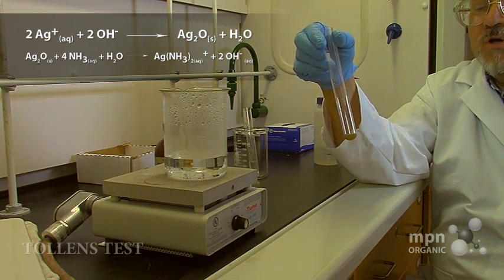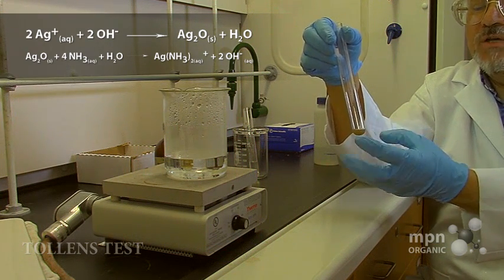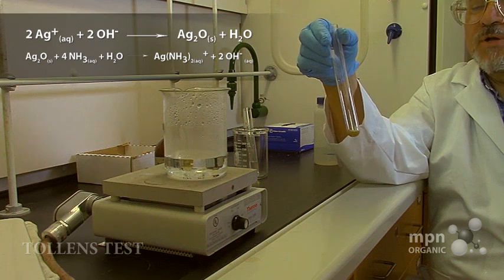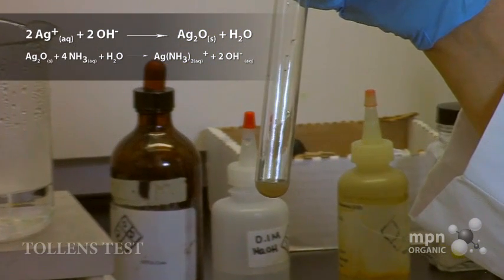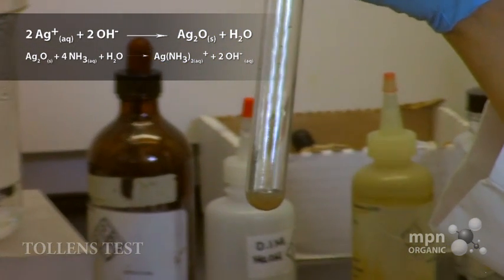And given enough time, all of this kind of milky appearance material will, in fact, coagulate and form silver oxide, which is a solid.